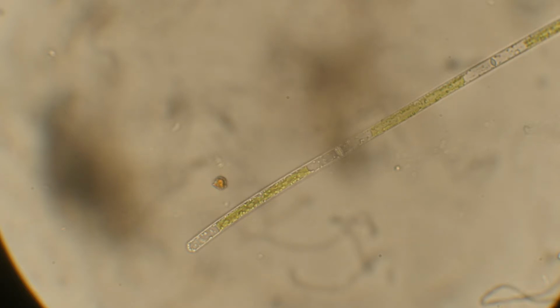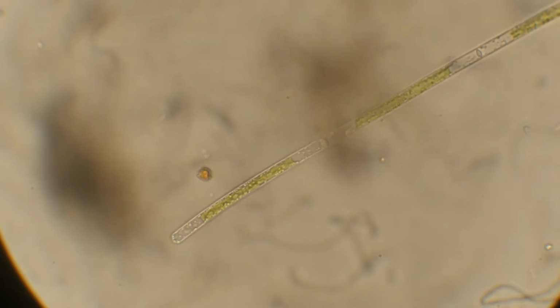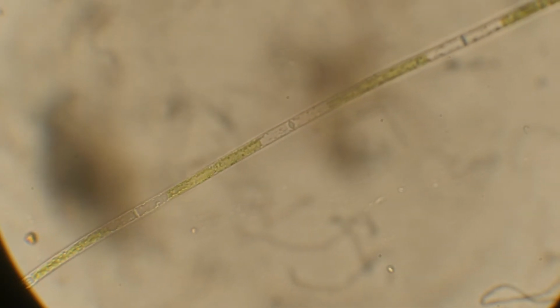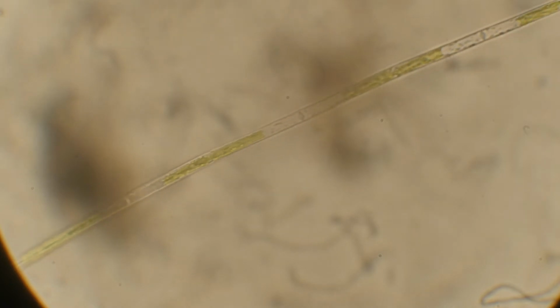So I'm not gonna try to be so exact. I don't know exactly where the sensor is in the camera, but at least 4 centimeters lower. So there's much less magnification. And as you can see, this MTV3 is very dirty. The MTV3, unlike the OEM photo tube, has an additional lens. So very interesting stuff here. But this is the 40X S-Plan.